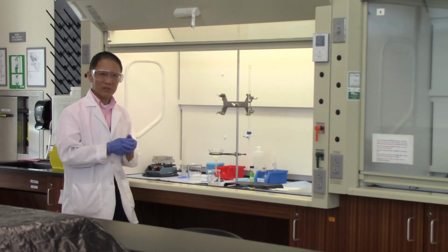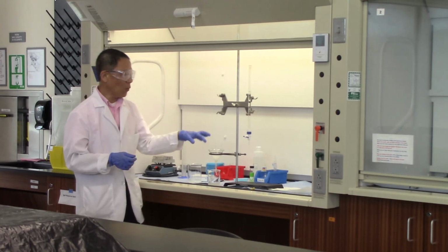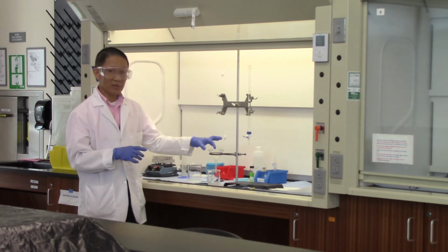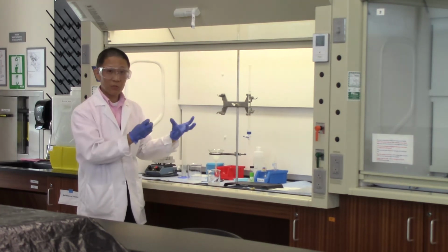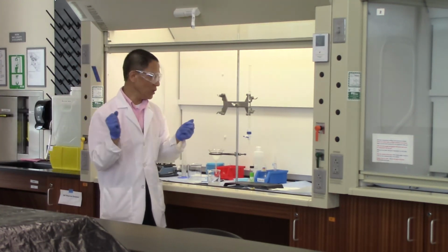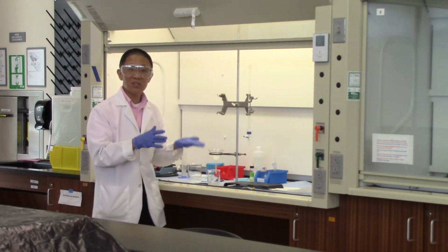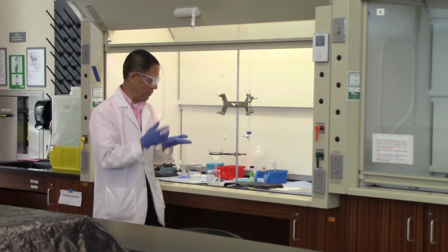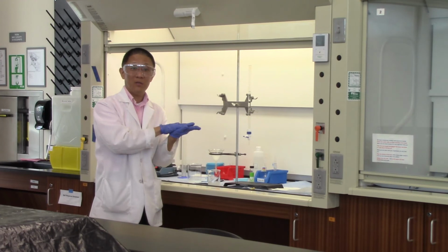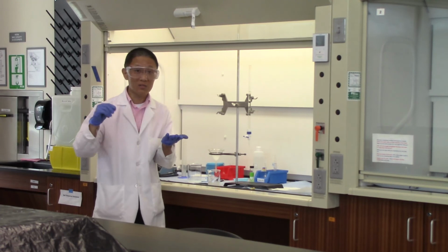This process may take a while when you're doing this experiment in the lab. Sometimes it can take as long as 20-30 minutes for the entire filtration to finish. Once you have everything filtered out, you have the liquid in the beaker and the solid in the funnel on the filter paper. That's how we determine the mass of the barium sulfate, because we know the mass of the filter paper to begin with. Once everything dries up, next time you come to the lab, you measure the mass of the filter paper with the sample on it, and you can determine the mass of the sample. That sample is the barium sulfate.